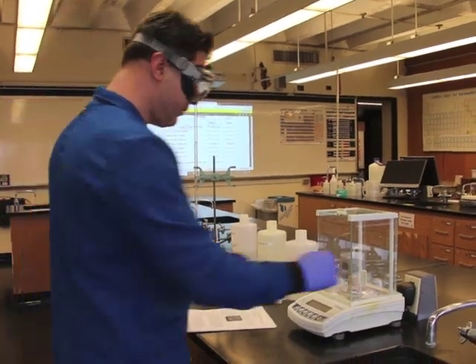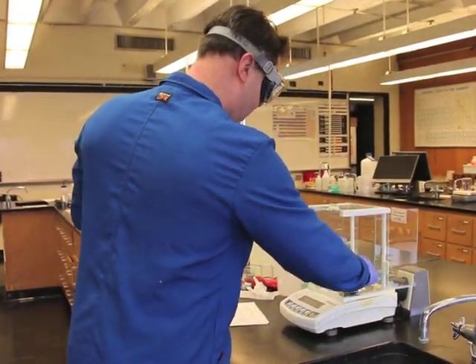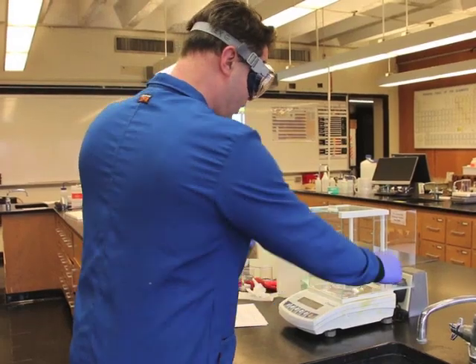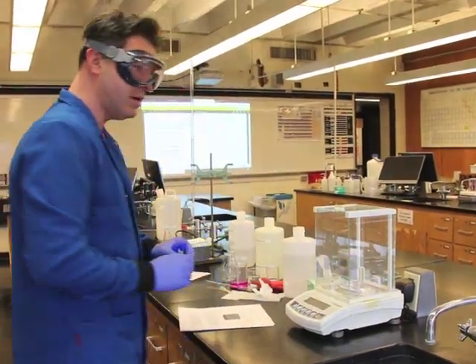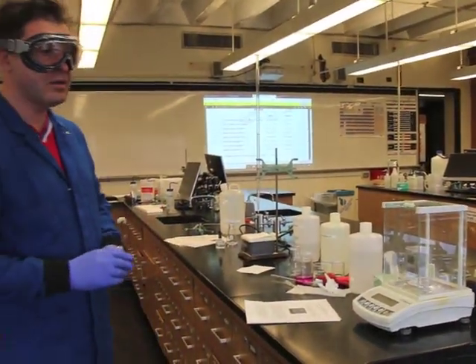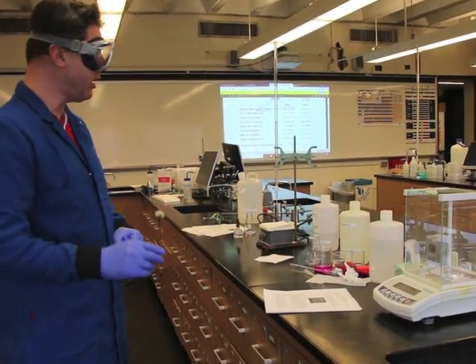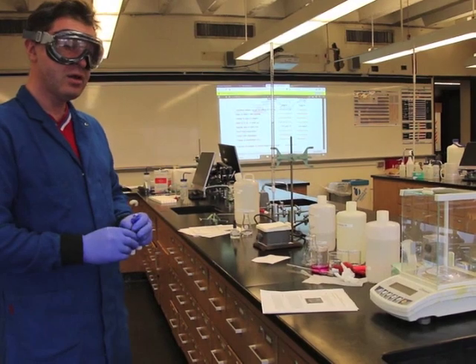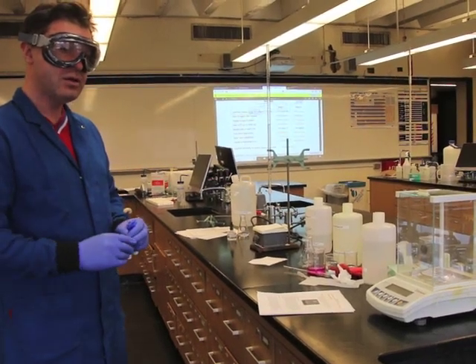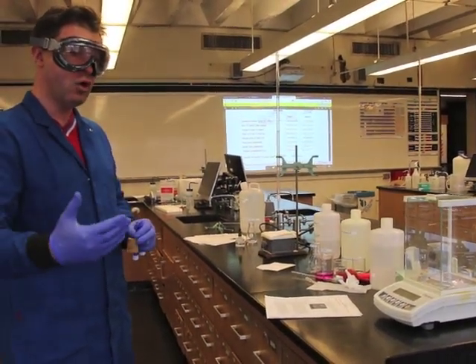Don't forget you will have to document the mass and I will show you guys in the data sheet these masses so that we can go to the next step.